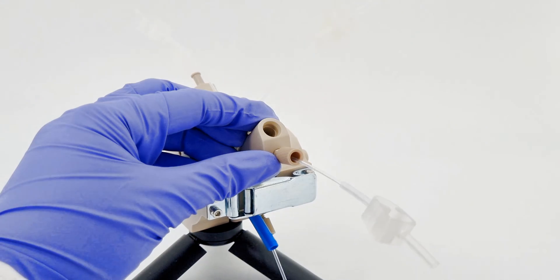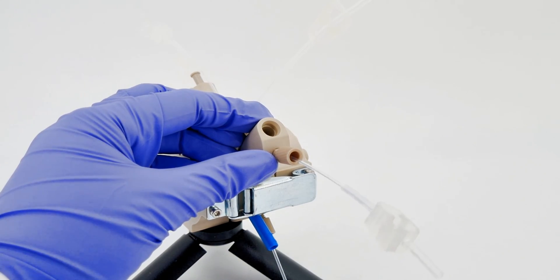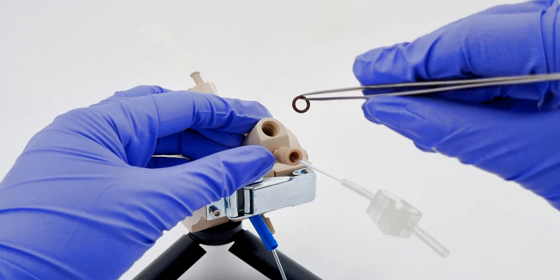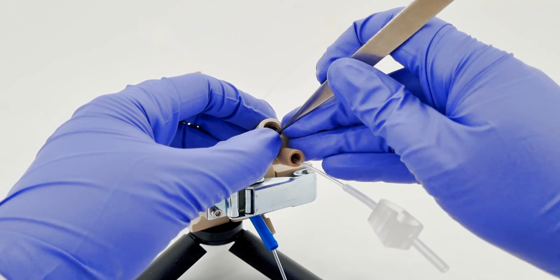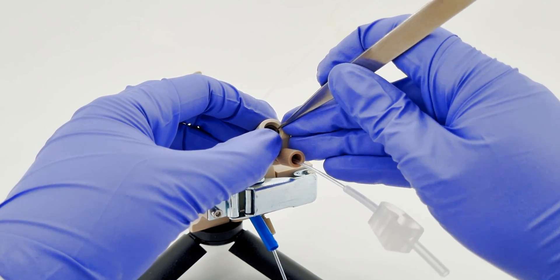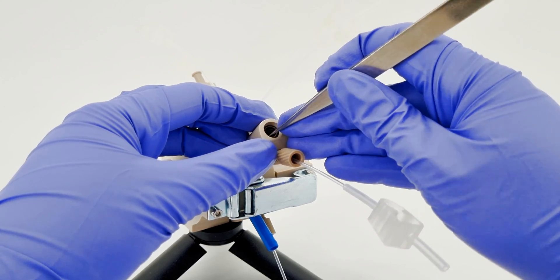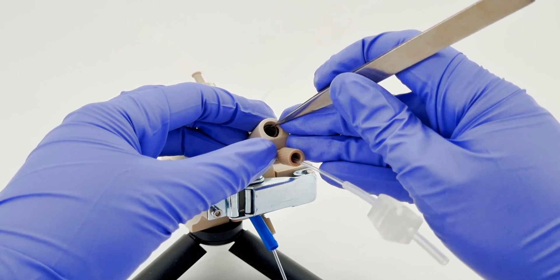Let's shift our focus to the reference electrodes. Firstly, remove the plug from this adapter, then slot in an O-ring. Make sure it sits flush against the lip of the inset. It might be a bit fiddly. That's where your trusty tweezers come in.